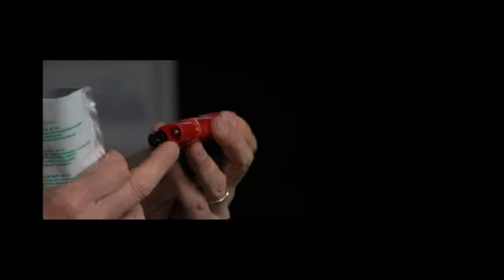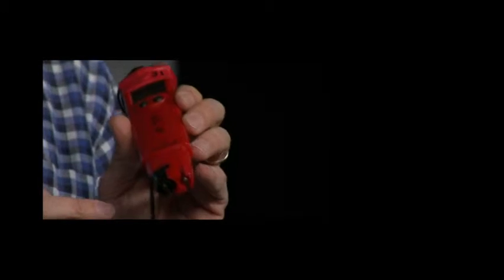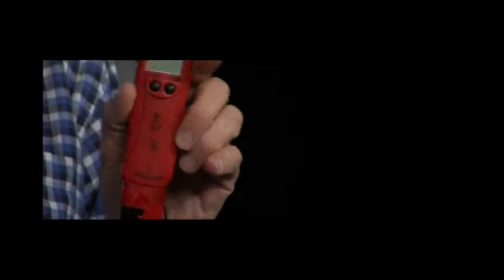The other sensor that's guarded here is a little shiny one that is a temperature thermistor. The temperature thermistor will actually record the water temperature. So this meter does water temperature and pH at the same time.